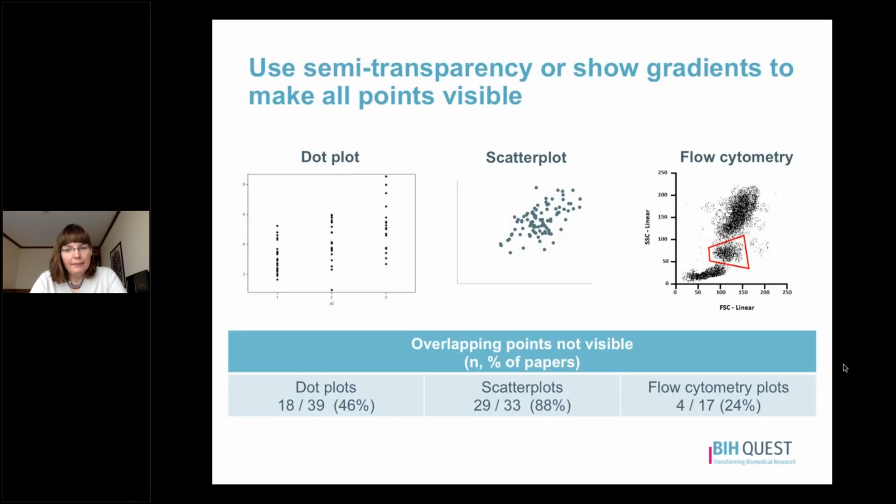One of the things that it's fairly common to see is that authors who are creating dot plots or scatter plots sometimes do this in a way where there are many overlapping data points. And whenever there are overlapping data points, they're in the same shade and they're solid. And so that means that they're on top of each other and we can't really see how many data points are there.